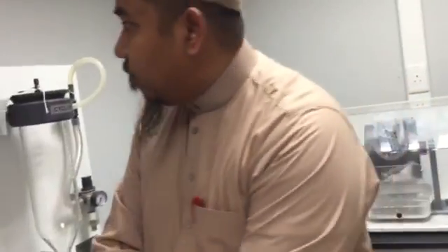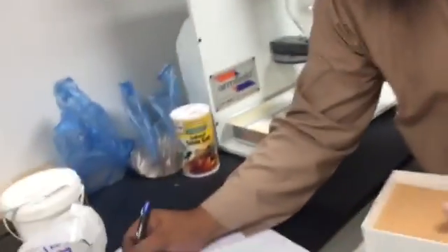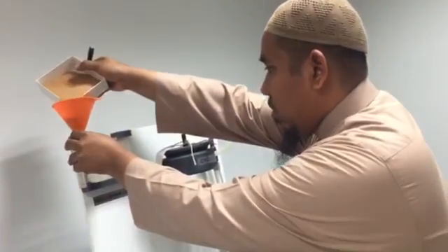Maybe from one run it's not enough. So what you do is, let's say you take the last one, okay? You collect from 3 runs, and then you put it here.